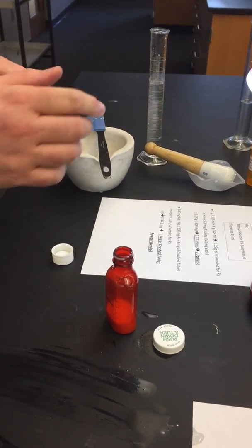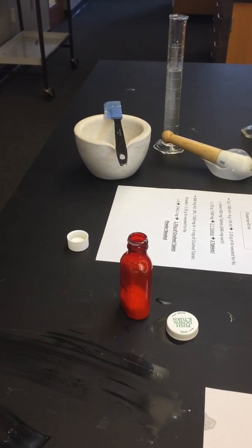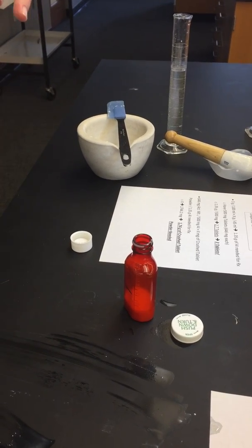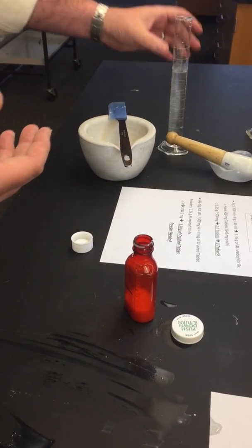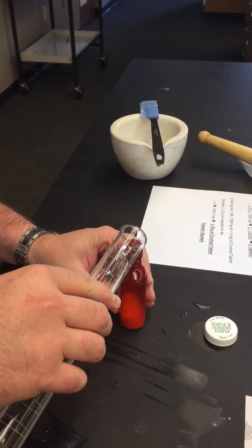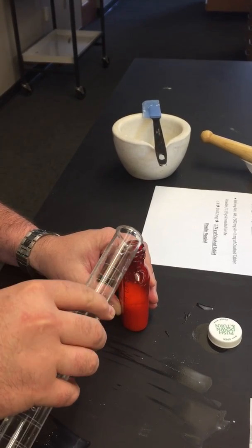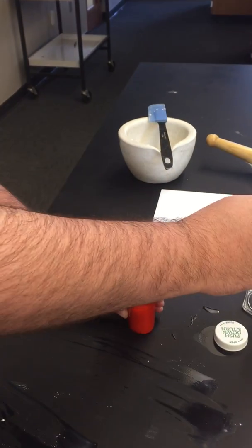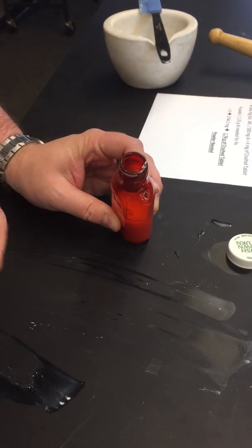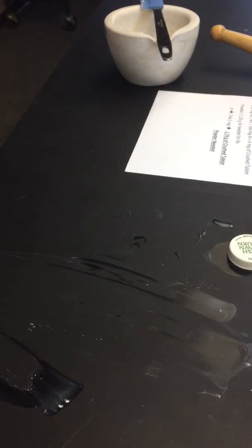What I was saying with the flavoring, you want to add that about halfway. So if you were to QS the total up to your 45 mLs, then add your flavoring, your concentration would be off. So now we've added our flavoring. We take our diluent that we're going to use, in this case again water. QS up to your final amount where your black line is. Don't worry about that, because when we shake it to reconstitute it, it will come off.